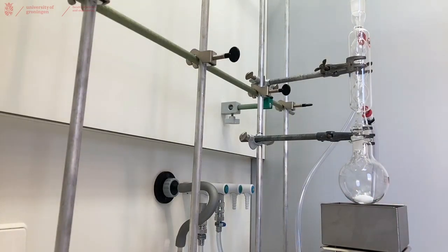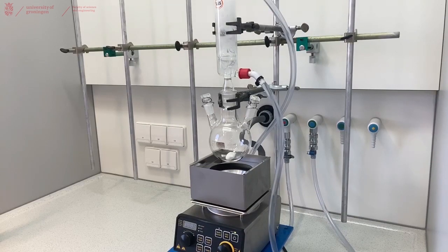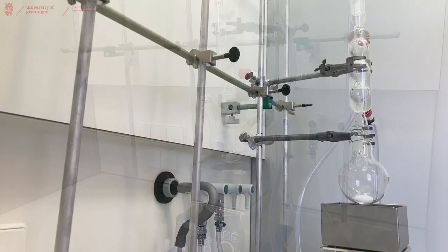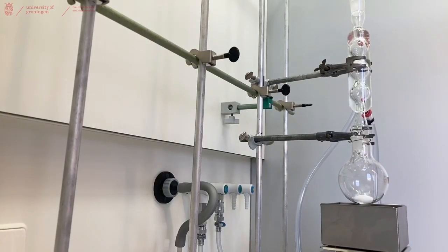Now you can slowly open the water tap and see the water run into your cooler. You will only need a small drizzle of water going through to cool your reaction. This is how you build a reflux setup.